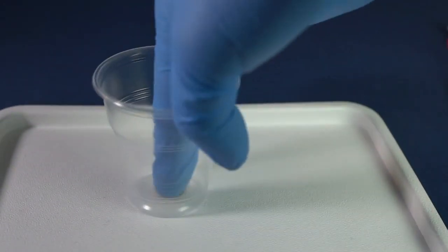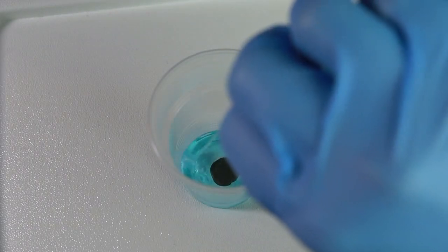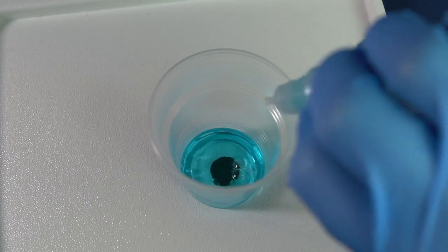Take one plastic cup and attach a little piece of playdough on the bottom of the cup. Then pour a whole bottle of copper sulphate solution, which will act as an electrolyte solution.